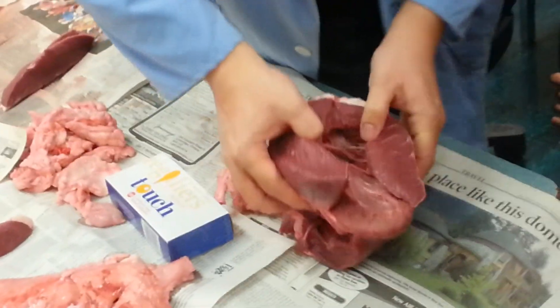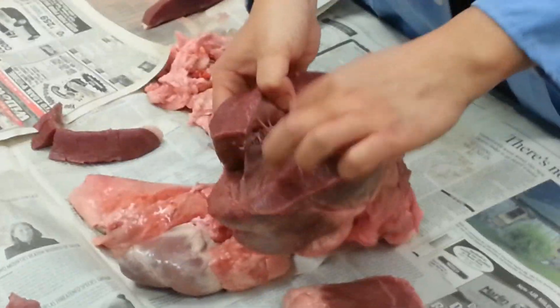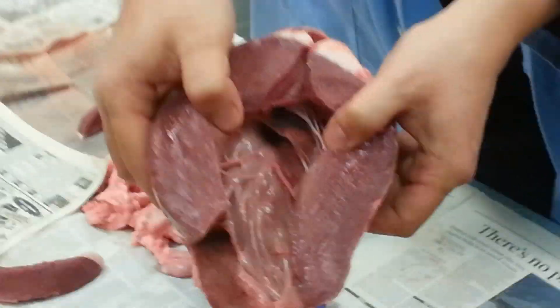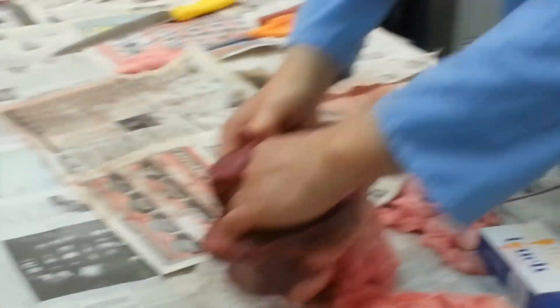You can pinch them together. See that? Yeah. And of course, chordae tendineae. And pinch them together like that. I want to hold it for you. See the valve at the top? And pinch them together like that.